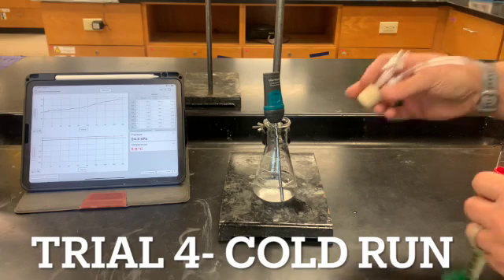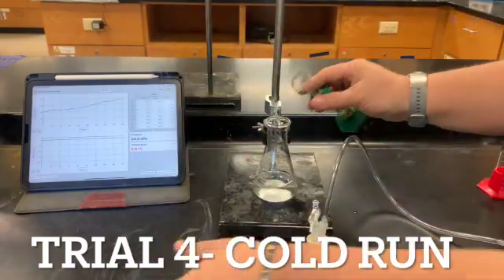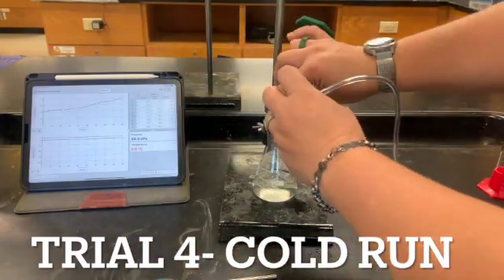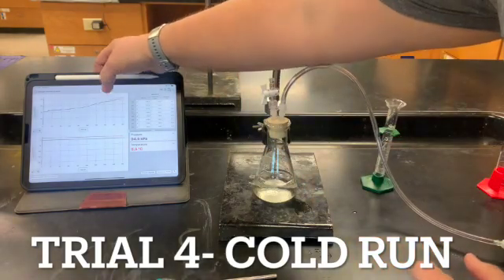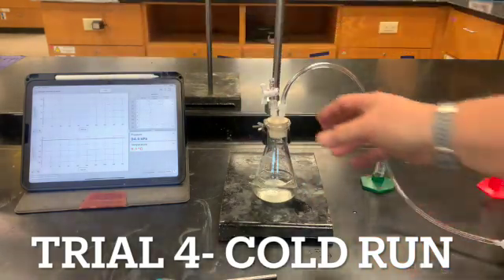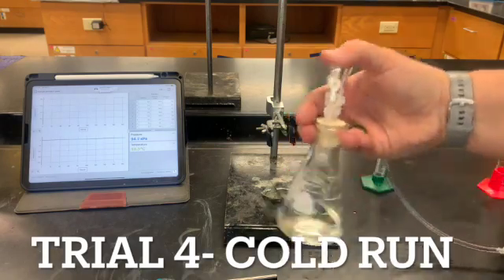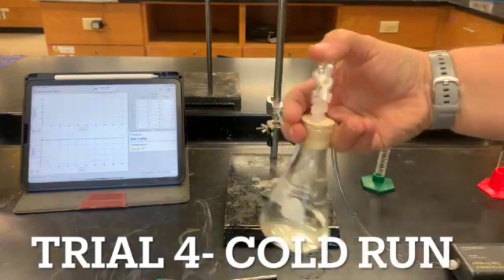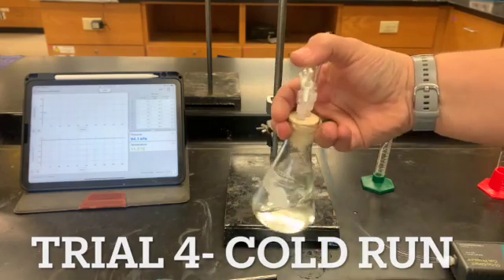Last one. I've got my gas probe ready to go. I've got the KI that's also been cooled off. All right, 8.9. Put it in there. And collect. And you can also hold it like this and shake it. And we're gonna let this reaction go, and this is the one that's supposed to determine our EA, right?